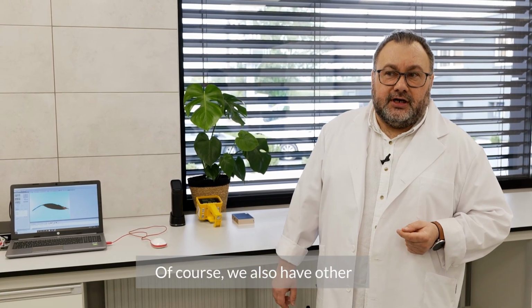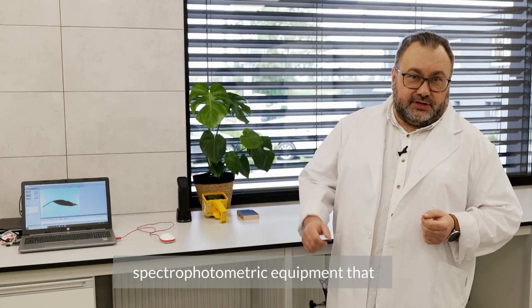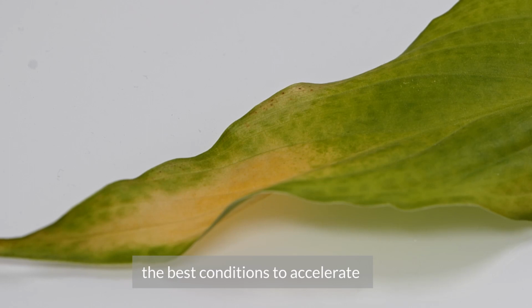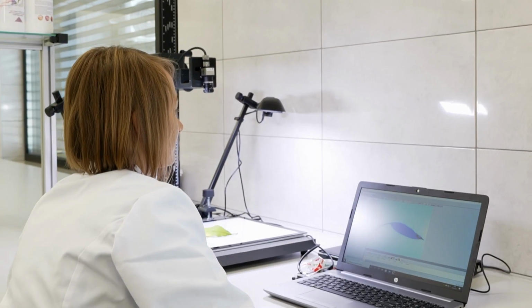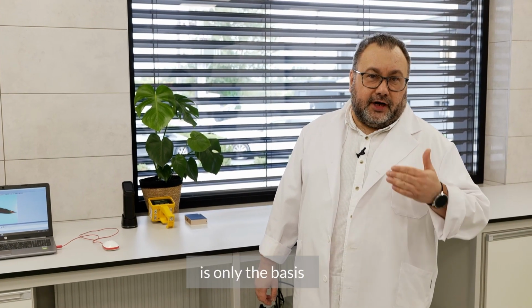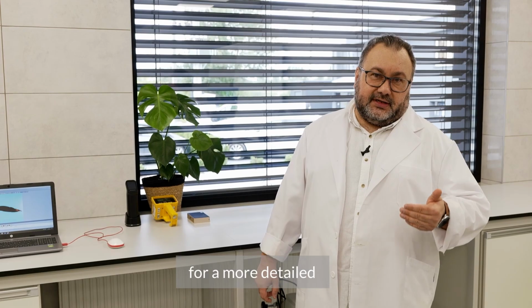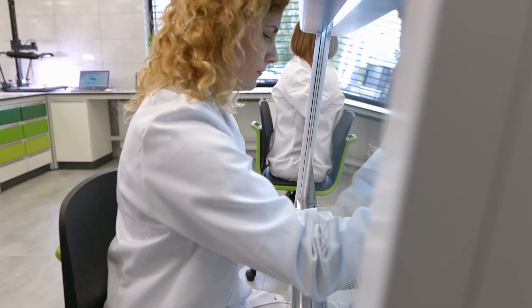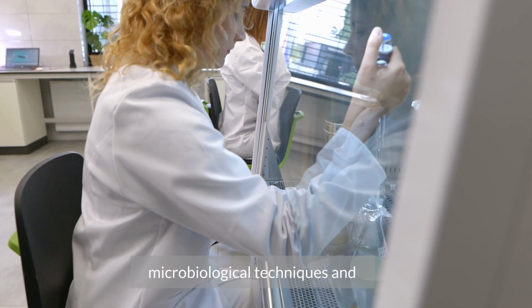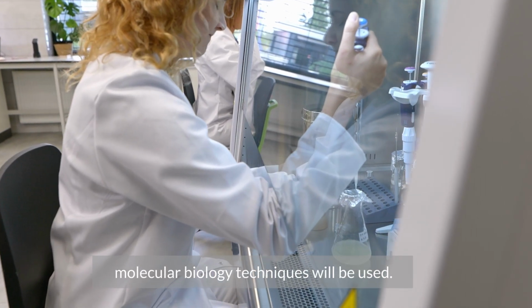Of course, we also have other spectrometric equipment that allows us to optimize and make use of the best conditions to accelerate the growth itself, the ontogenesis of plants. Of course, such physiological research is only the basis for a more detailed study of plants. For that purpose, various microbiological techniques and molecular biology techniques will be used.